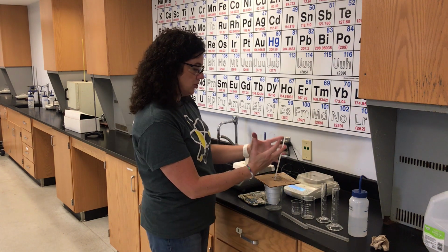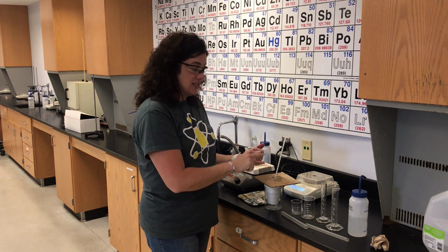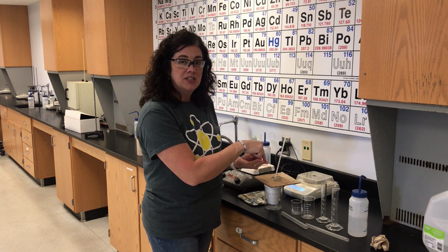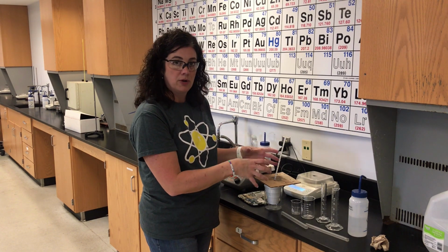In a way, with this calculation for calorimetry, you are using the formula that we discussed in lecture, that you also see in your pre-lab, Q equals ms delta T. You have two different systems you're looking at. You've got some information about the calorimeter. That's about the water. So when you do Q equals ms delta T, it's the mass of the water, the specific heat of the water, and the change in temperature of the water in the calorimeter.